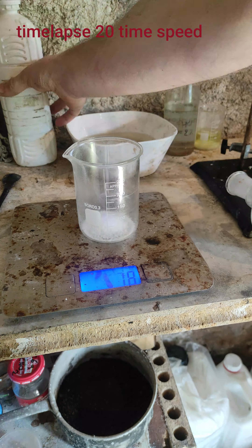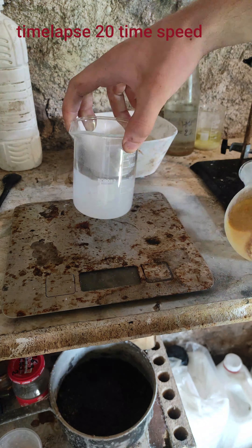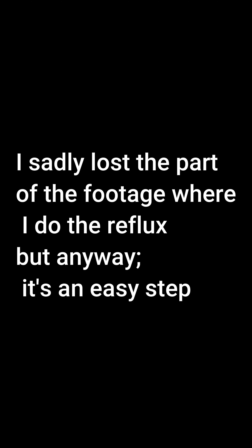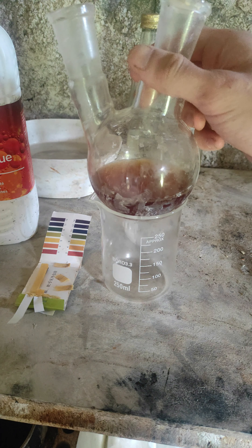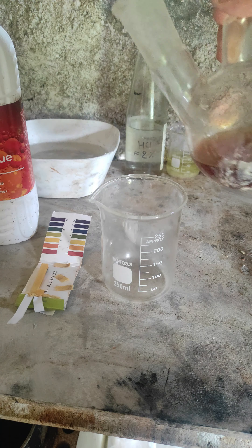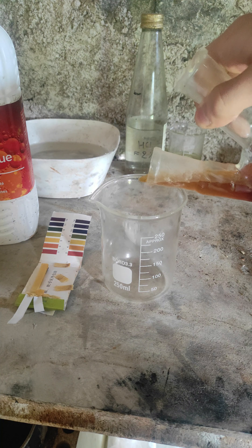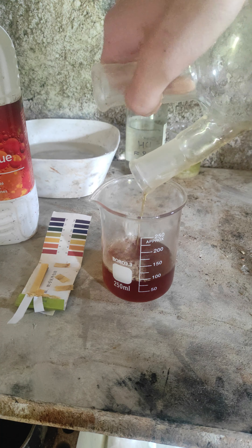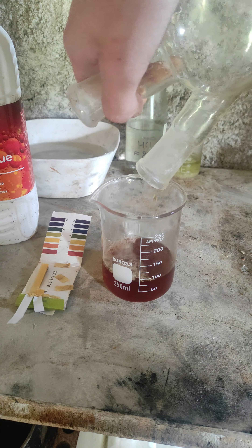We will now do the hydrolysis. First measure about 10 grams of sodium hydroxide and dilute it with some water. Then we put a reflux on the mix to complete the reaction. Once that is done we can precipitate our insoluble salicylic acid. This step needs pH control to know when we have added all of the hydrochloric acid needed. The pH needs to be 1.